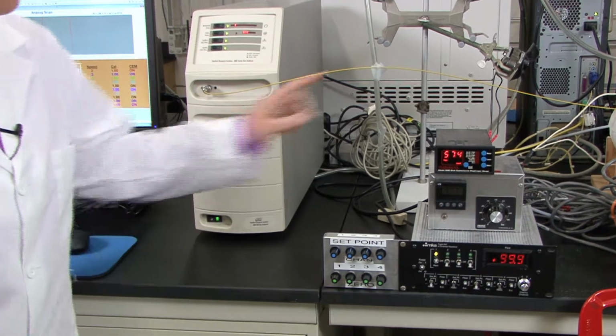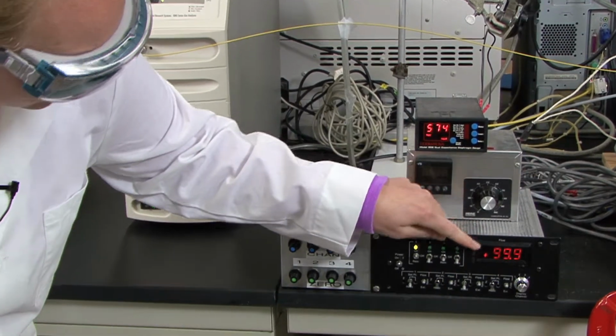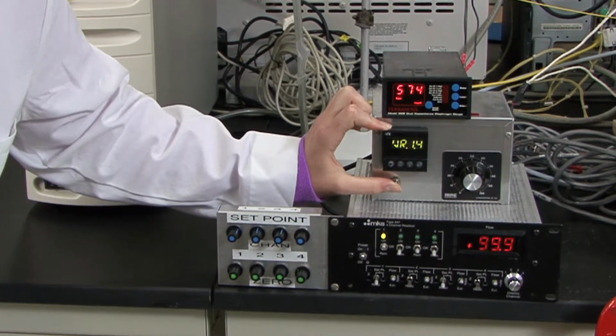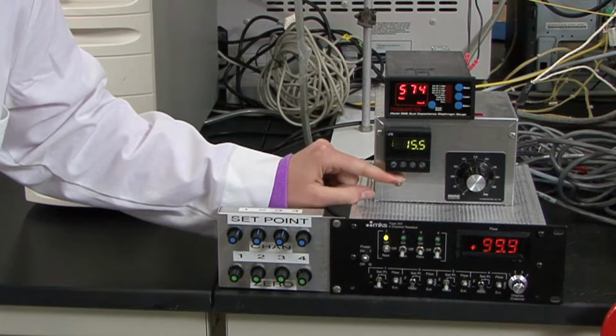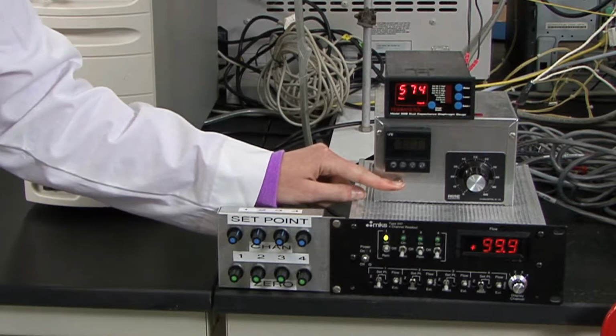And then you'll want to write down the total pressure, which is 574, the actual flow rate, which was 99.9 SCCM, and then you'll want to record the temperature. So to do that, you flip up the temperature switch and wait for it to load, and then write down the temperature, so 15.5 degrees, and then flip that off after you've got the temperature because it will continue to heat the catalyst if you leave it on.